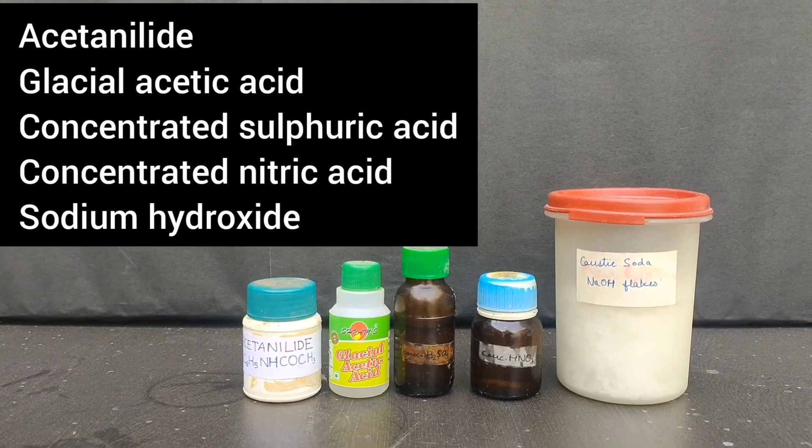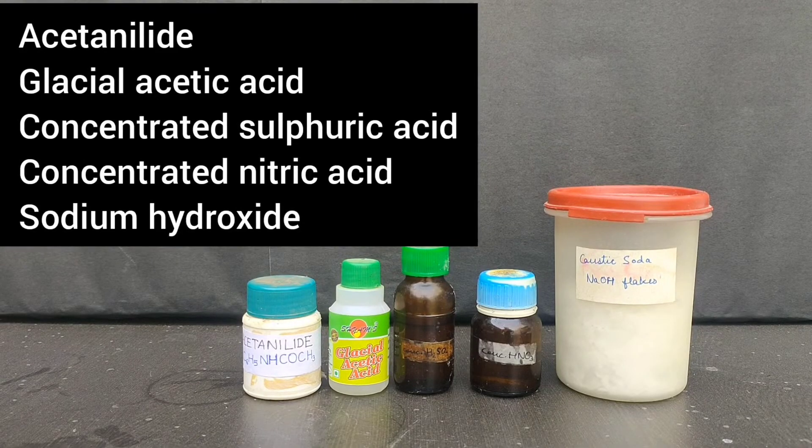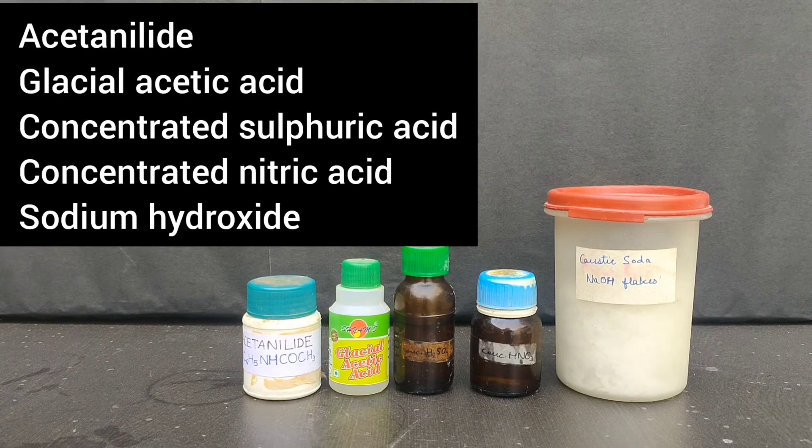These are the chemicals required: Acetanilide, Glacial Acetic Acid, Concentrated Sulphuric Acid, Concentrated Nitric Acid, and Sodium Hydroxide.